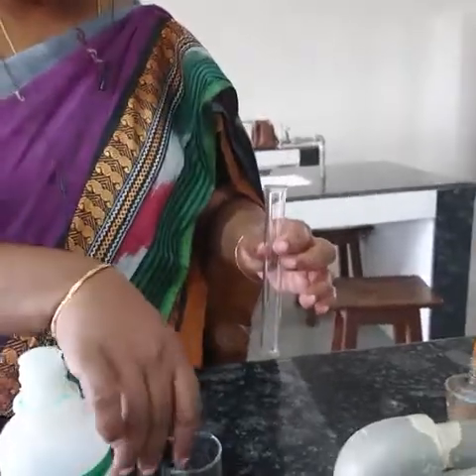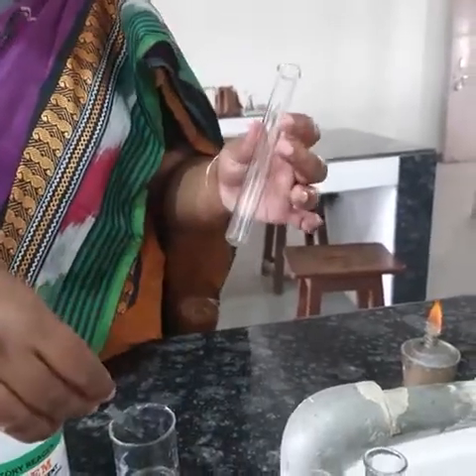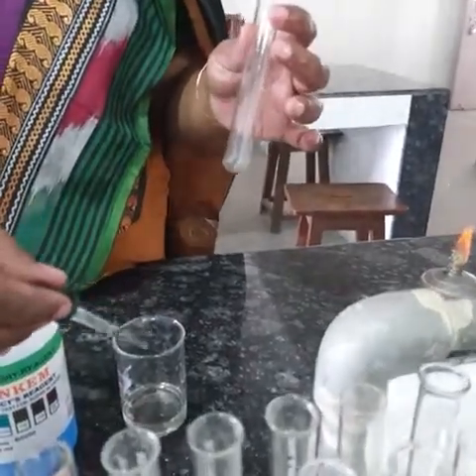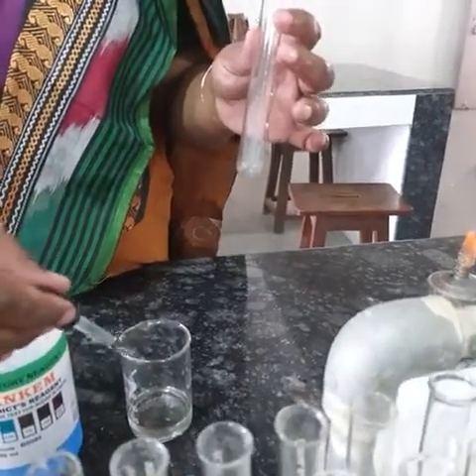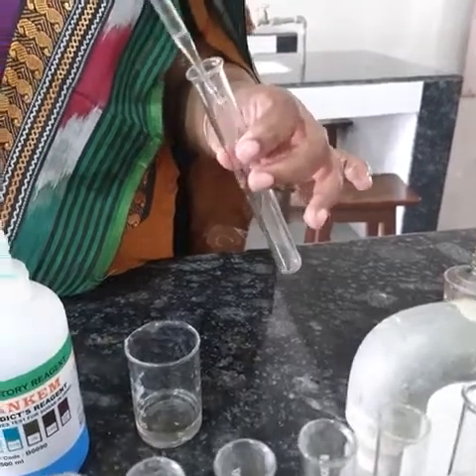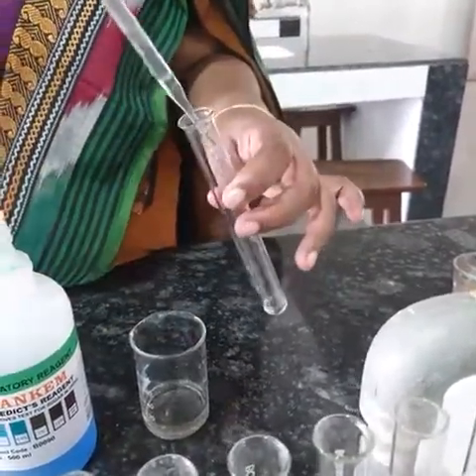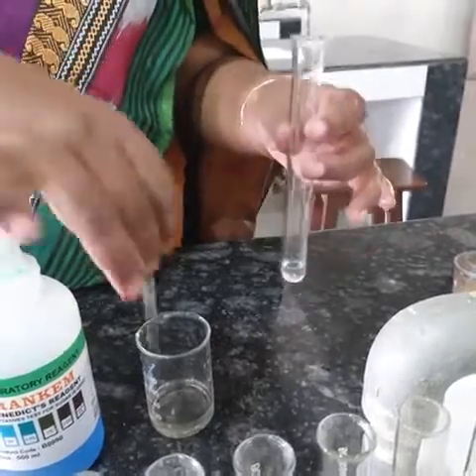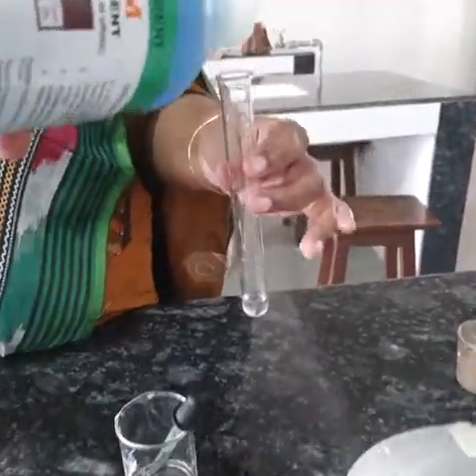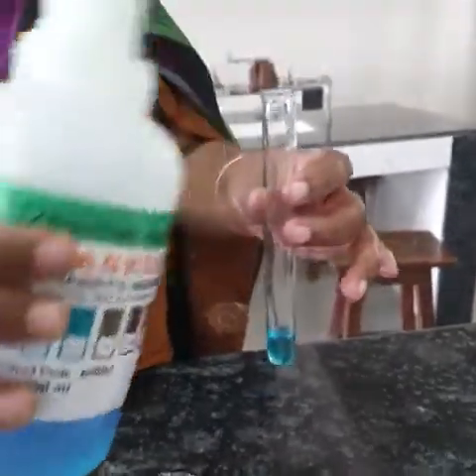Today we are going to perform a glucose test. For performing the glucose test, we need a test tube, glucose solution as a sample, and Benedict's reagent. I am taking 2 ml of glucose solution and adding 2 ml of Benedict's reagent. This Benedict's reagent is blue in color.